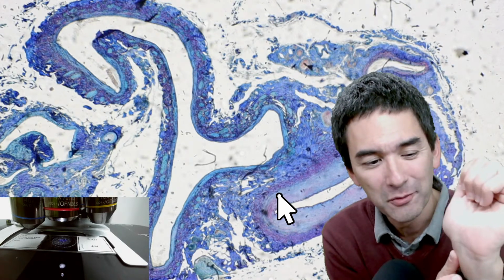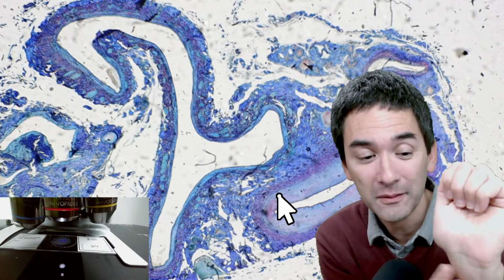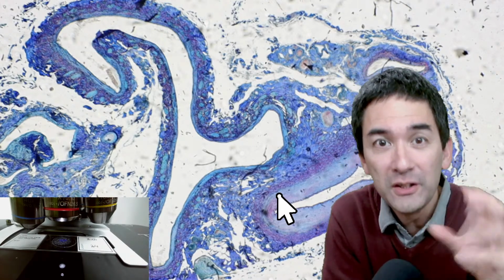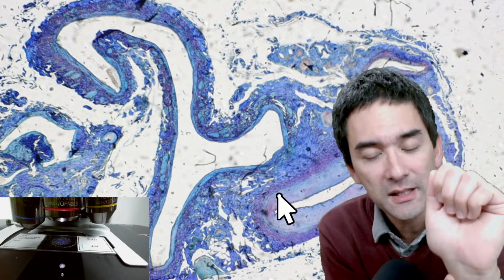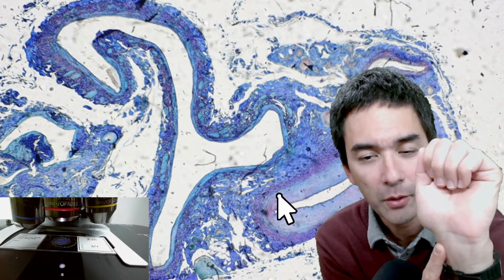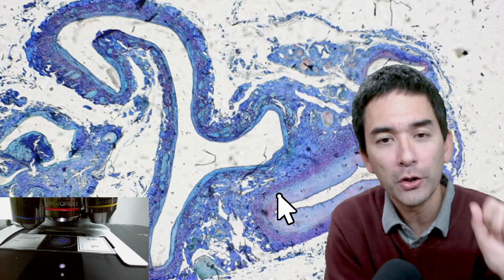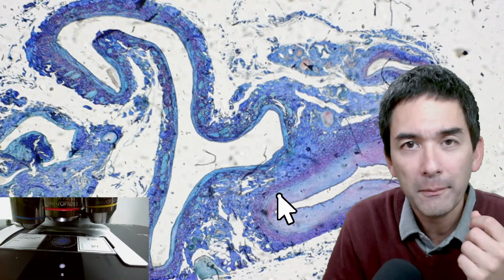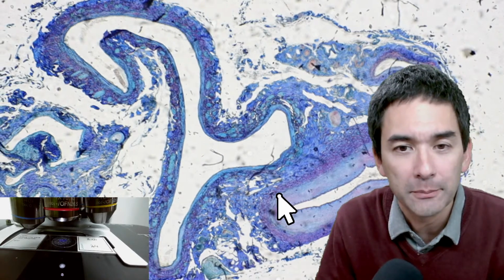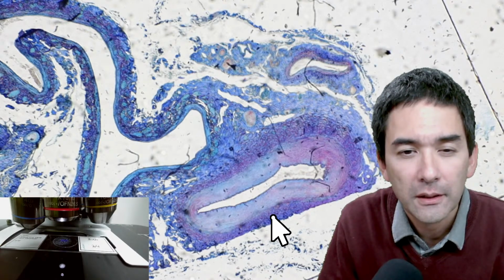Some of my students always thought, and even I myself used to think, that the pulse that you feel is because the artery kind of continues to pump the blood, but that's not correct. It's simply a result of the blood pressure changing. Every time my heart beats, the blood pressure rises, and I'm able to feel that. And because arteries have a high blood pressure, they must have a thick wall in order to withstand the high blood pressure. And what we have over here is an artery, the cross section.